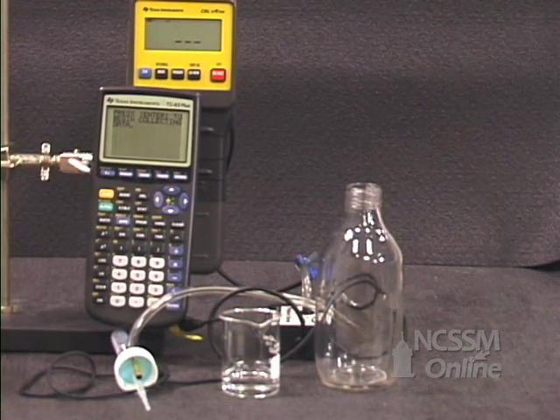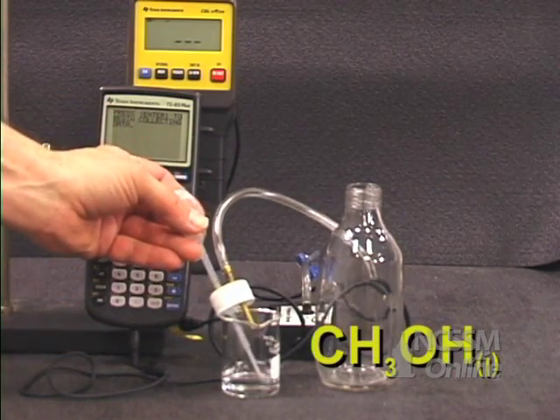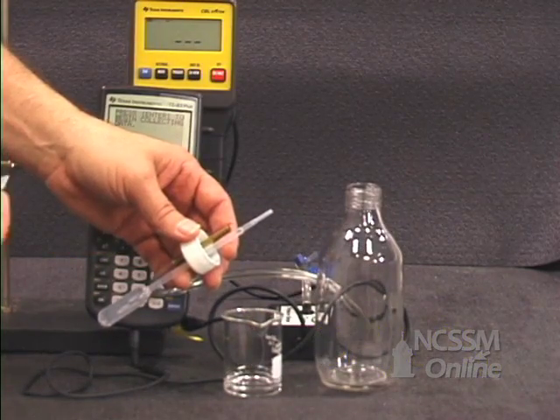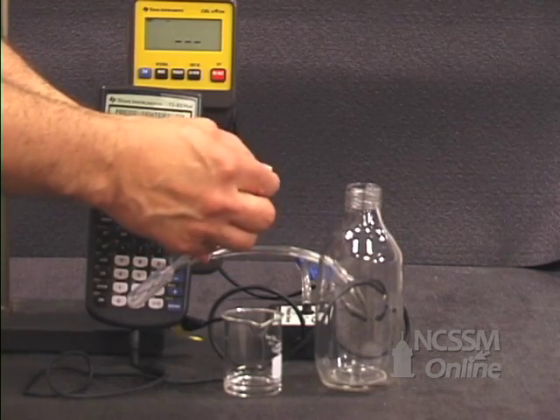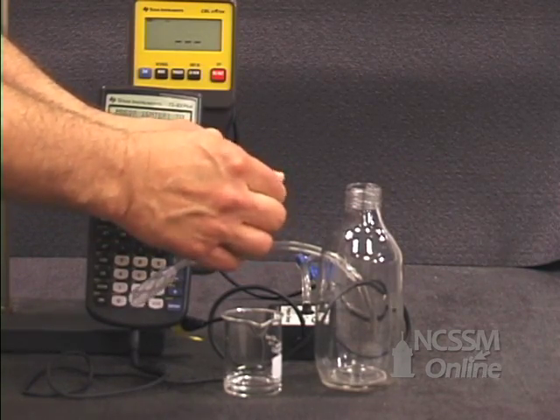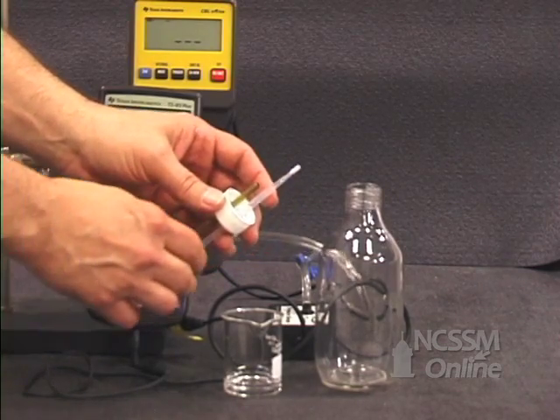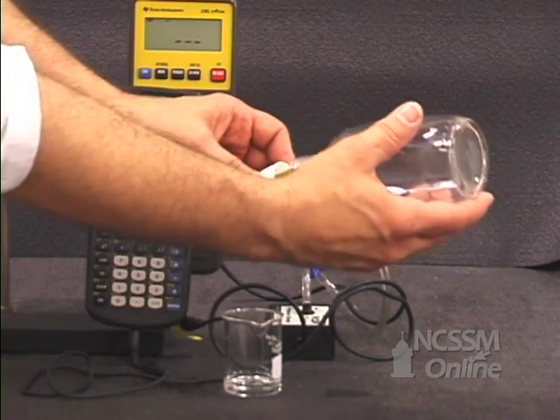I'm going to fill the dropper with some liquid methanol. Once the pipette is filled, I'm going to put a small amount of parafilm over the end of the pipette tip to keep the liquid from leaking out. I'm going to now attach the pipette to my bottle.